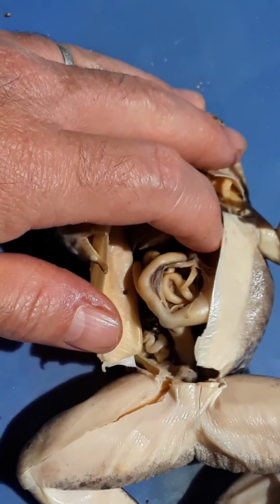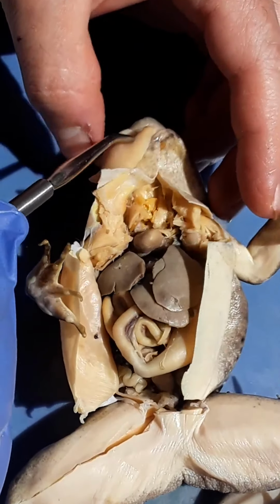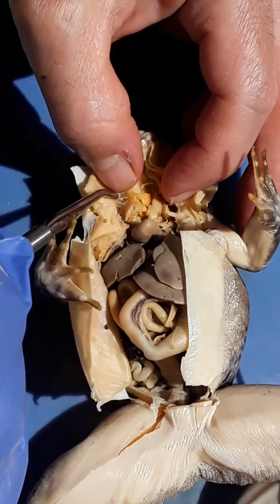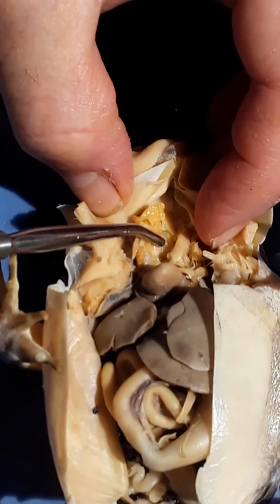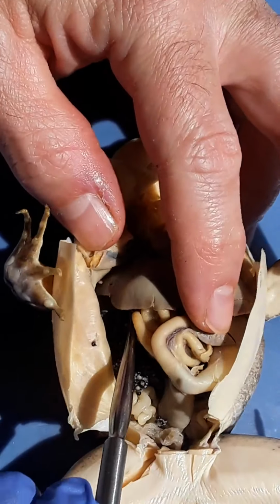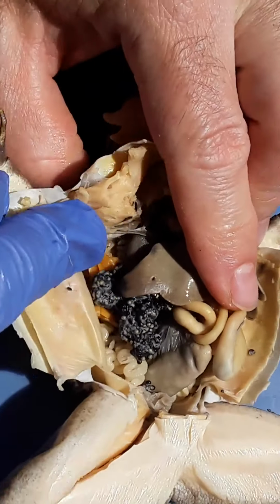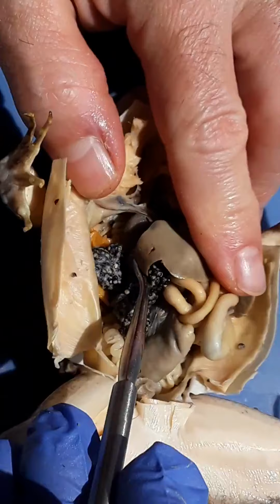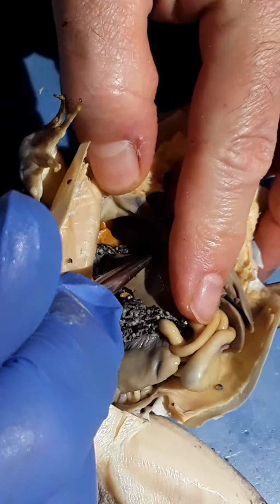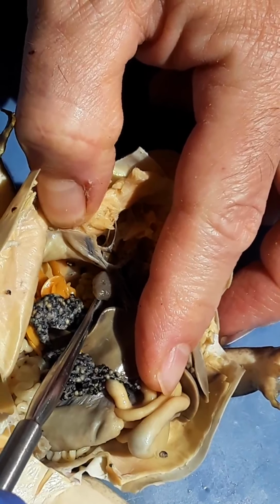The next thing would be the lungs. Okay, so can't really see the trachea, but there's two pipes that come down from the mouth. One would go down into the lungs, which, as we look, are pretty far dorsal. If we flip this stuff up, flip up the liver, here's one of the lungs on this side.